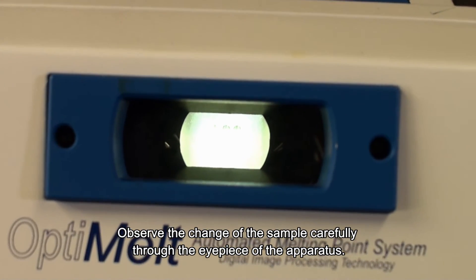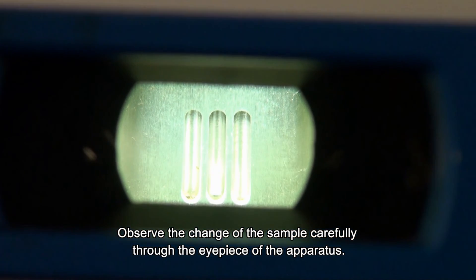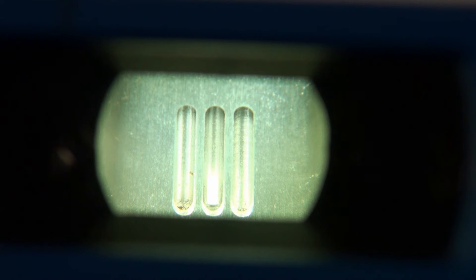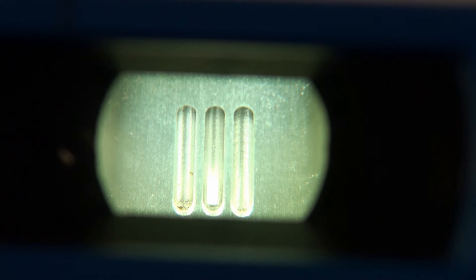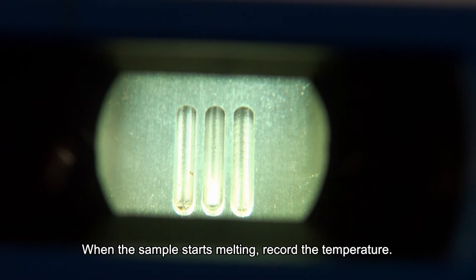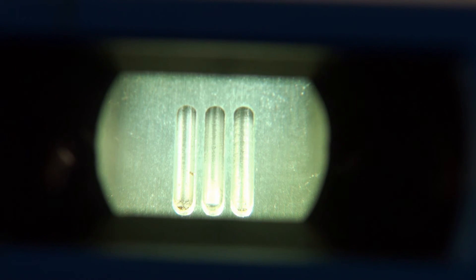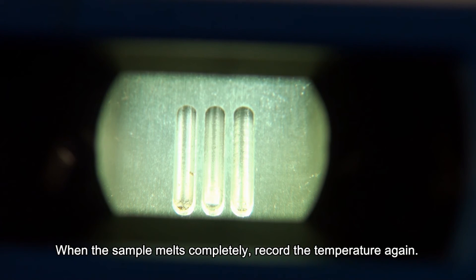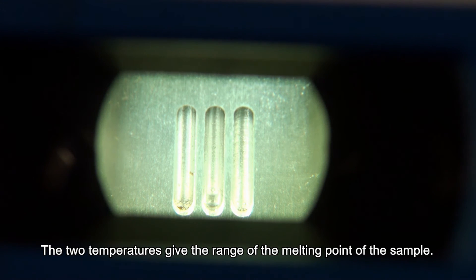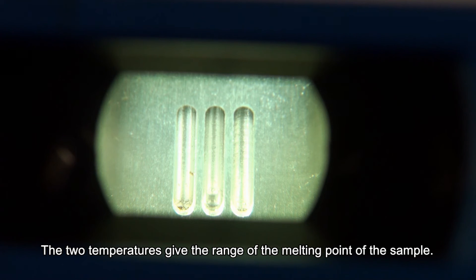Observe the change of the sample carefully through the eyepiece of the apparatus. When the sample starts melting, record the temperature. When the sample melts completely, record the temperature again. The two temperatures give the range of the melting point of the sample.